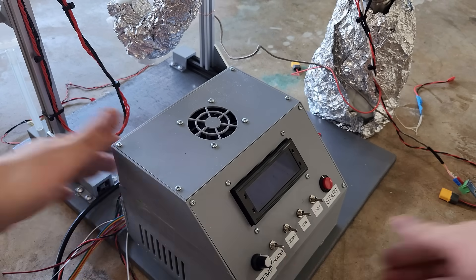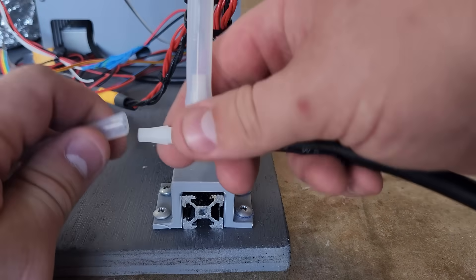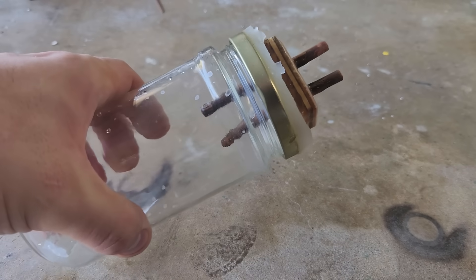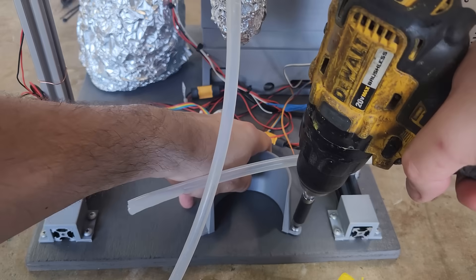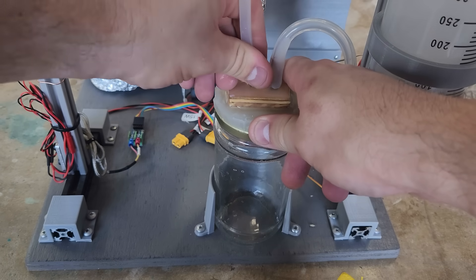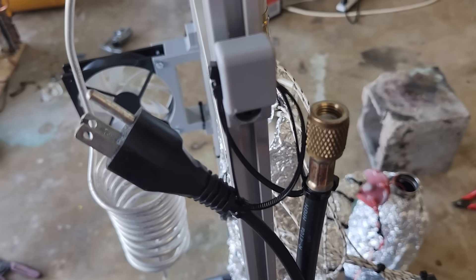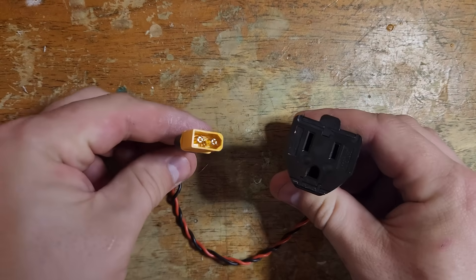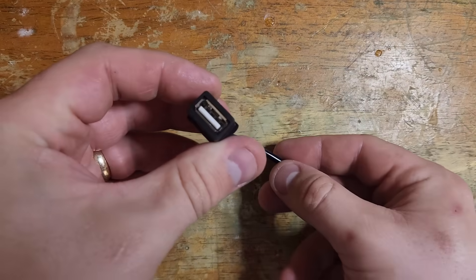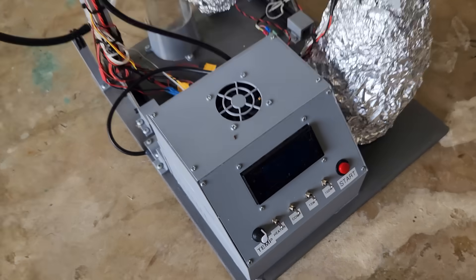The control box sits at the front of the fixture with all wiring at the back. The gas output hose has a quarter-inch NPT flare adapter connecting to my transfer compressor, plumbed through a T-barb fitting to the syringe and the liquid trap output. The liquid trap is a cleaned-out pasta jar with copper tubing added and sealed — it holds around 400 ml, which should be enough for an entire liter of ethanol dehydrated. I also added a clamp for the 120-volt cable, a zip tie holder for the gas output hose, and a hook at the top of the frame to keep things organized. A funky adapter provides mains power to the compressor on the turn-on signal, and I added a USB extender since I couldn't access the Arduino's USB port once everything was in place.